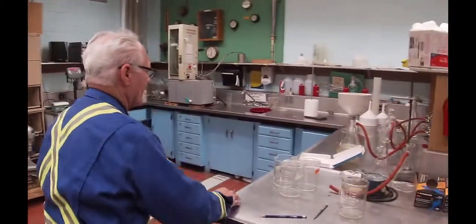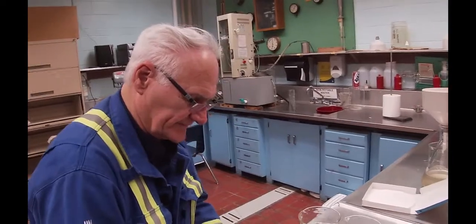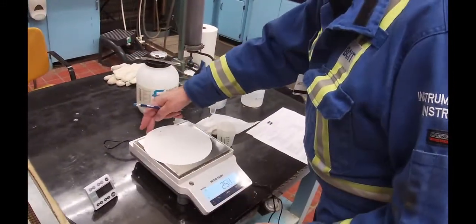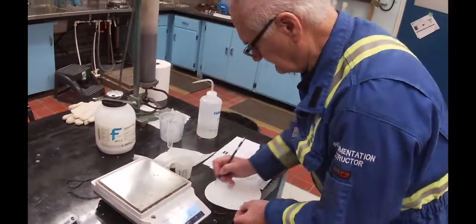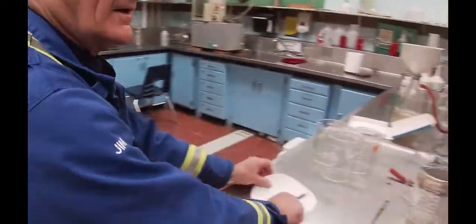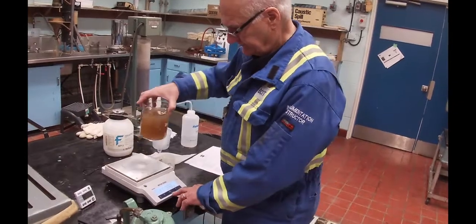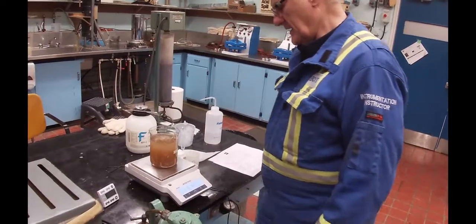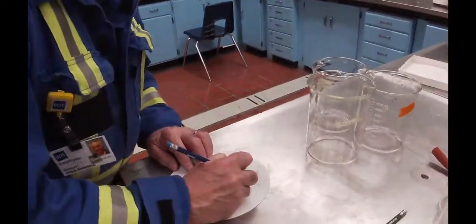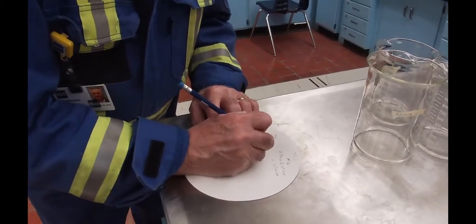So we're going to do it again. This is number two. The filter paper weight is — clear that out — 2.49 grams. The slurry plus beaker is 1,167.6 grams.